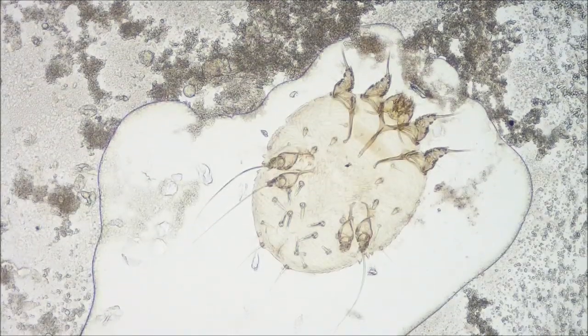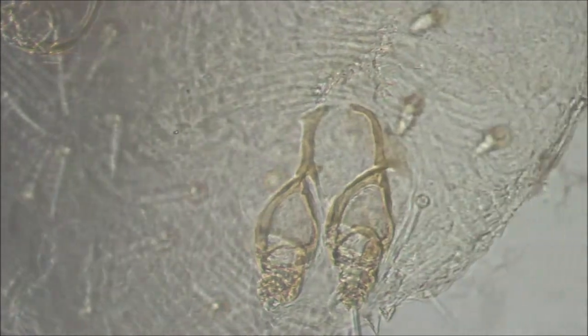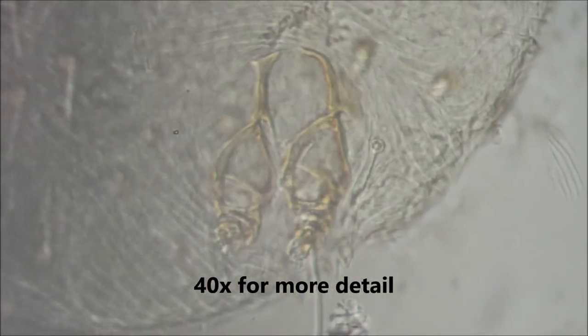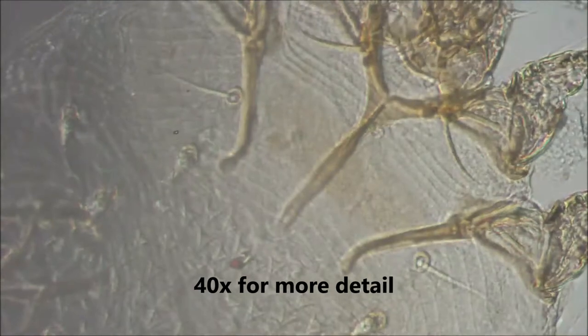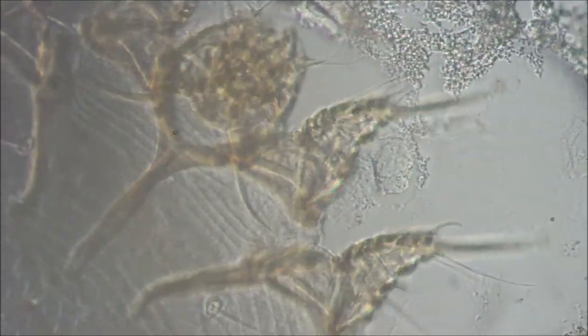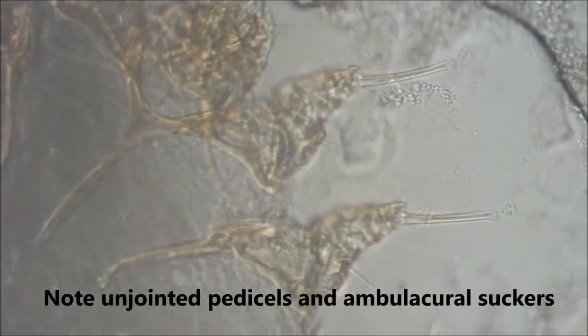Using your 4x lens, scan slowly and thoroughly. This is a sarcoptic mange mite, and by increasing to 40x you will see further morphological features. Note the unjointed pedicels and ambulacral suckers.